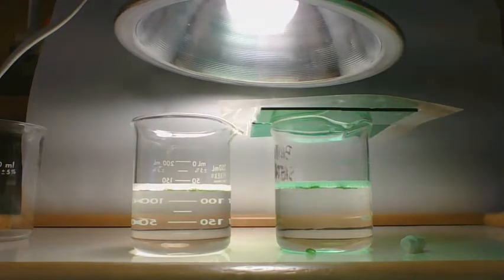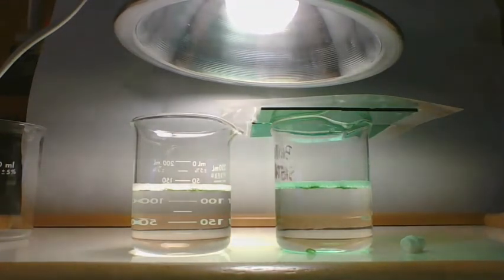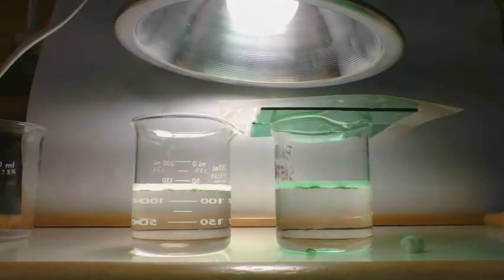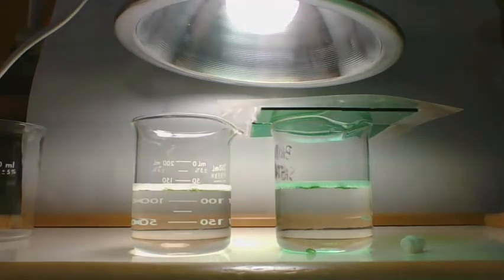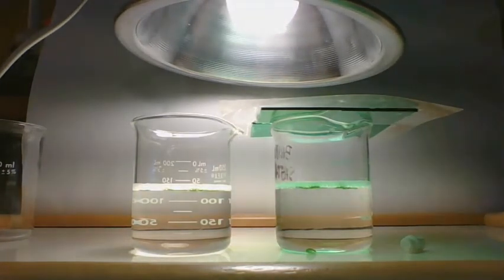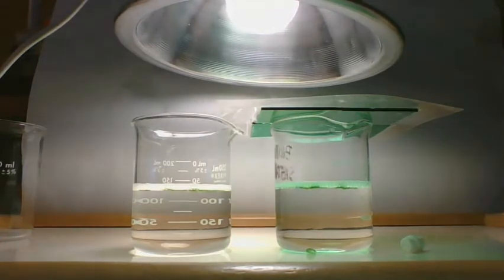If we get this all done before 15 minutes, we'll turn it off. If both sides are completed before 15 minutes, it's definitely going to get turned off. If not, we keep it on until it goes. All right, 5 minutes. We have 10 on the white light side and 9 on the green light side.